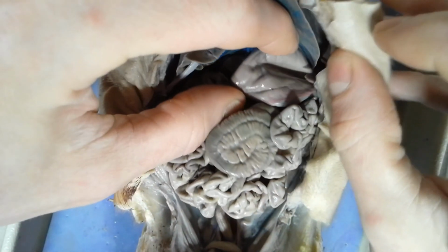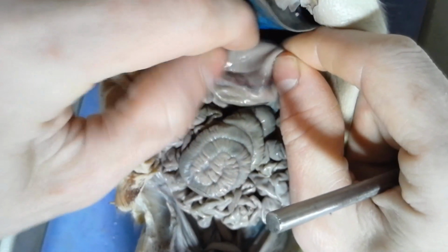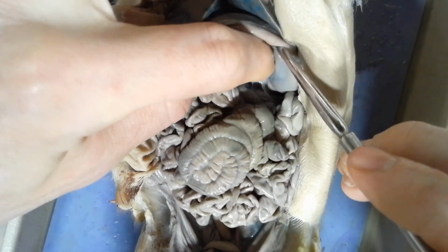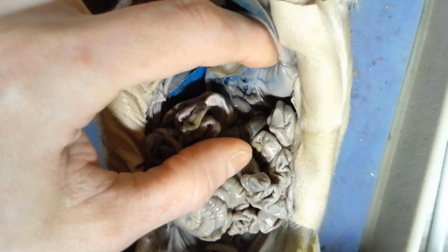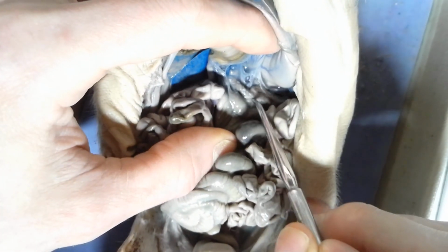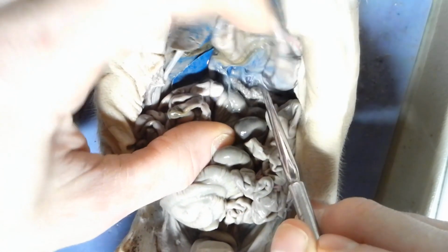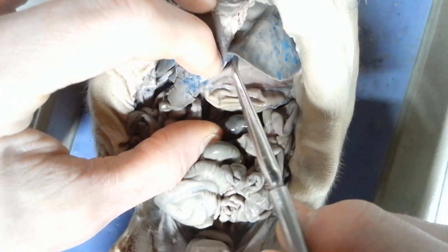Okay, next, underneath the liver, so I'm pulling the liver up here, you have this baggy organ right here. This is the stomach. Okay, so the stomach right here. Okay, and if I pull the stomach up, and then dig a little bit deeper here. Deep inside, you see this little glandular tissue right here. This is the pancreas. So the pancreas is underneath the stomach. So here's a flappy stomach. I pull it up. Here's the pancreas. Pancreas, stomach, liver.